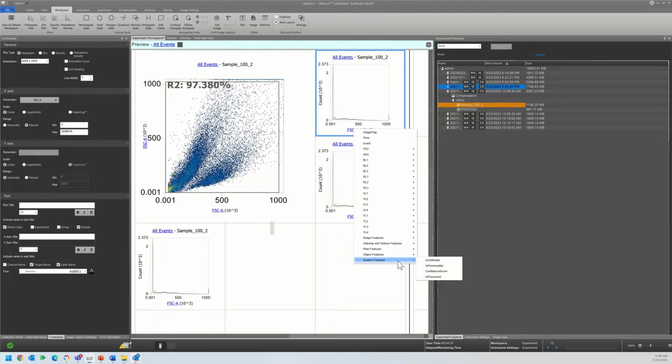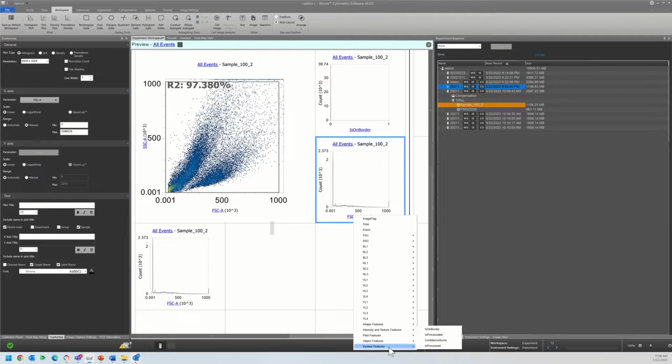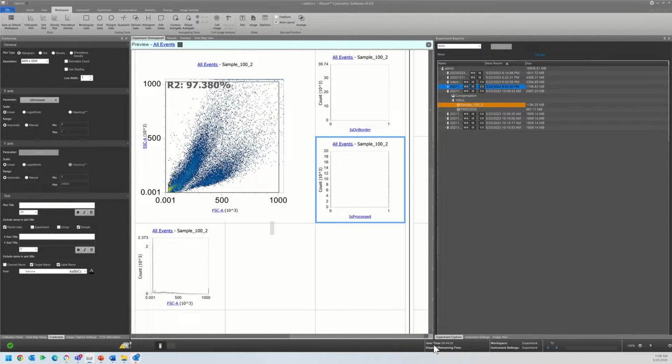So system features, the 2 that we are going to want to focus on are is on border and is processed. And the entire goal here is to make sure that we have excluded any events that have not been fully imaged, which would lead to incorrect values for area, perimeter, and other calculations, and that we are only working with processed imaged events. So events that have an image attached, which is actually processable. So it is not just noise, and it was successfully processed.